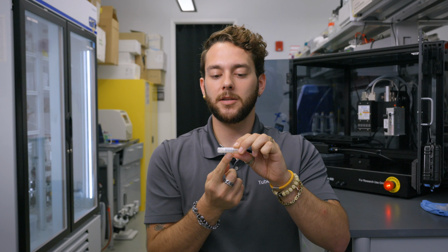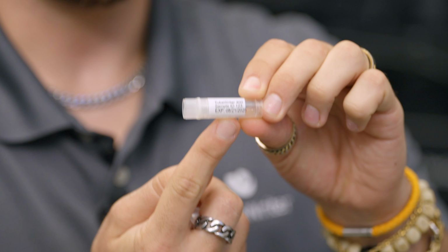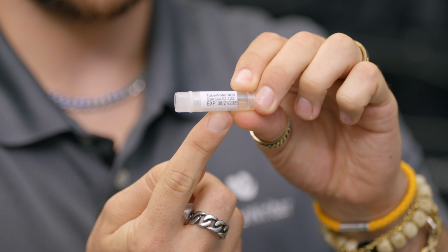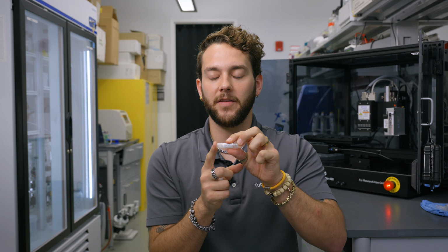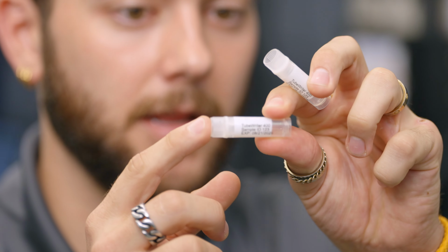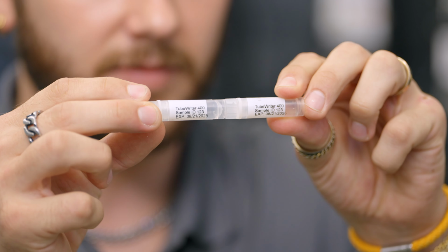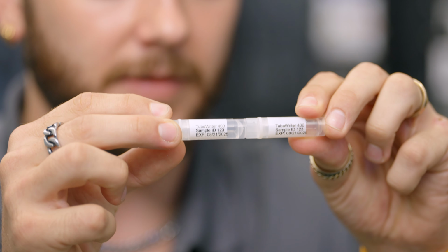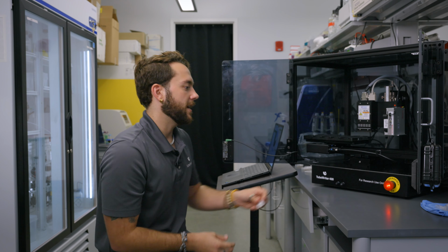So if you look at this tube, the last line of text on it seems to be a little bit more stretched out and not as crisp as the other 2 lines. To fix that, we'll need to adjust the distance between rows, because this is the 50th tube. Here was the first tube that we just printed, and all 3 lines of text look good. None of them are stretched out compared to that last line of text. See how that last line of text is a little bit more stretched out? So to fix that, we'll change some settings using the distance between rows.